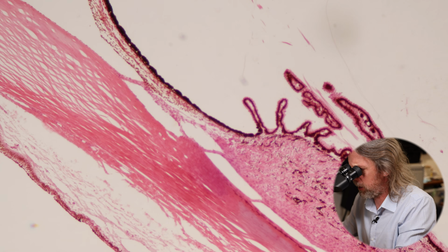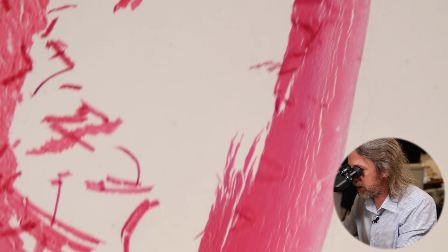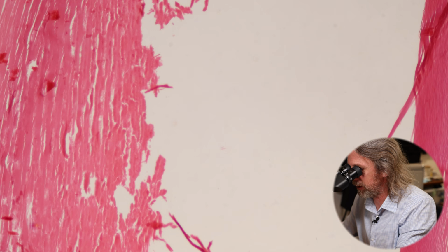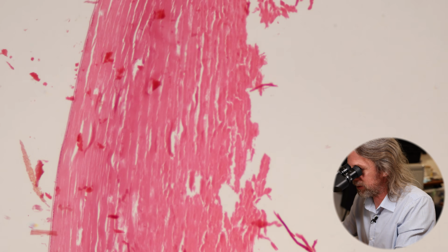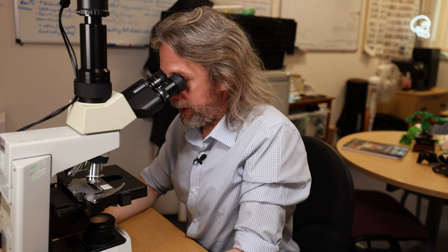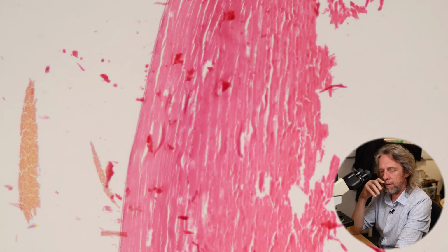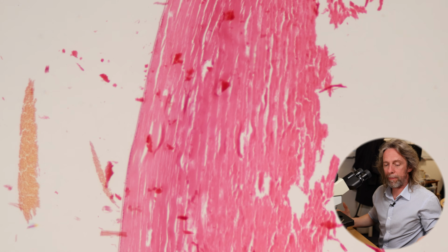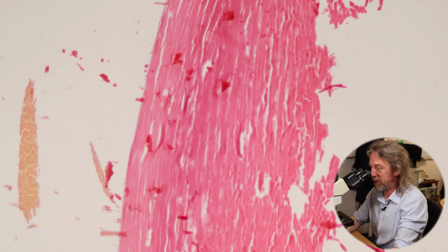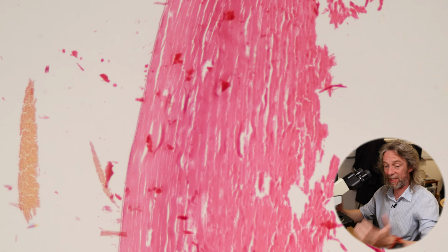All right, one thing left to talk about, and it's this guy up here, or what's left of him. Now, I haven't looked at this yet, so I don't know what this is going to look like. But this is the lens. Now, I think the lens is a bit weird. I guess it's because I'm a connective tissue biologist, or was. It's not really connective tissue. What we're looking at there is cells, or the remains of cells that have taken up the stain that was added to the section.